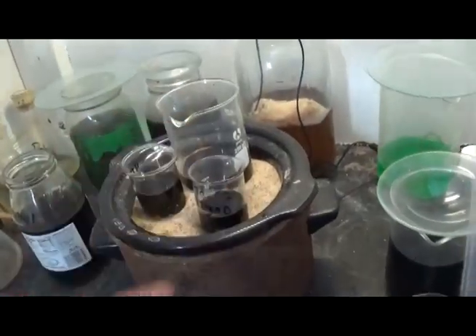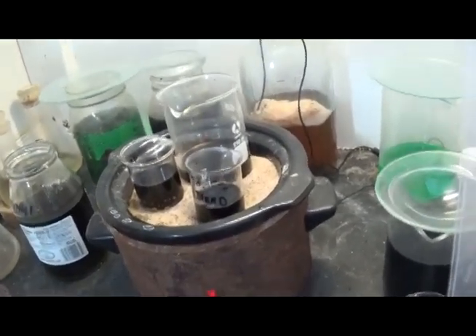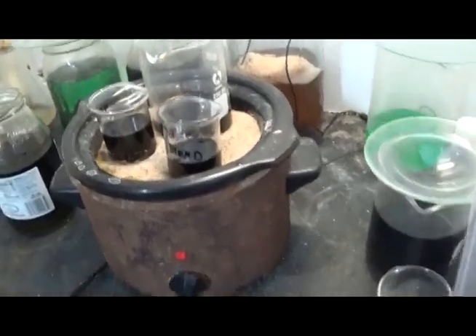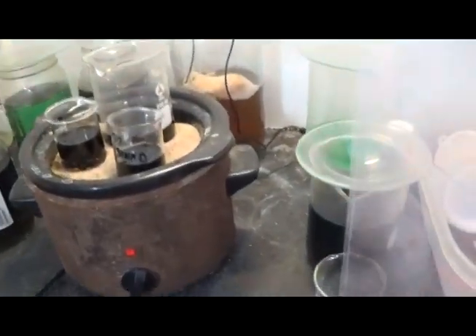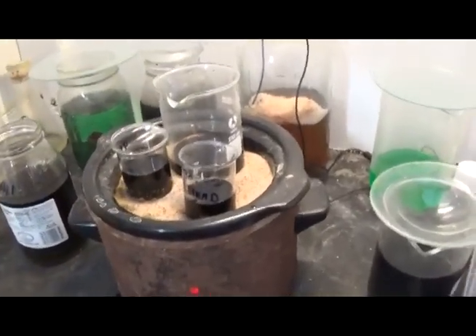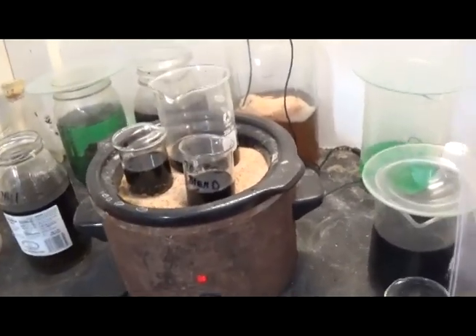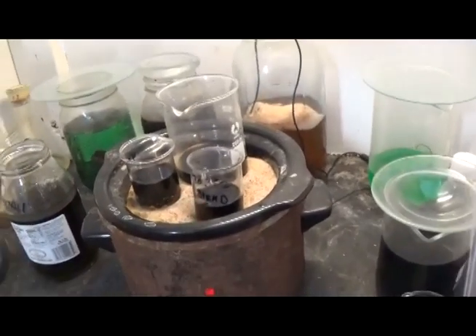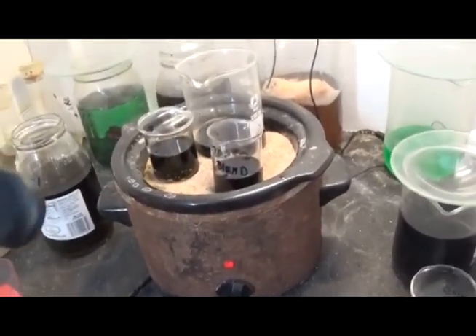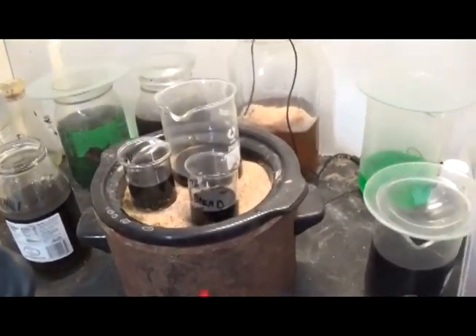When I checked that one, it was definitely absolutely just a foil — it done its job. You can see the very dark color, that's what we want to see. It got to that color and stayed. Very good — I think that's good news. We'll be back closer to the time this is due to end. It's a 48-hour cycle and we'll examine some foils, hopefully find out which one of the three is the best. That's the goal.